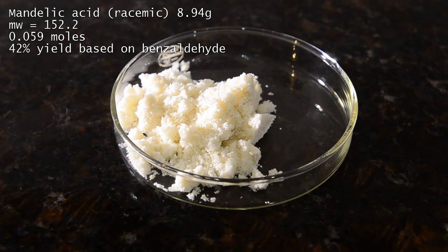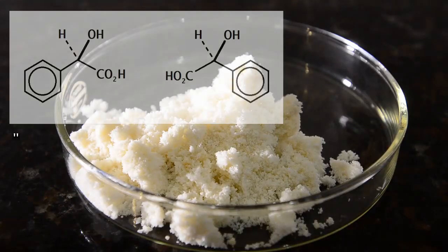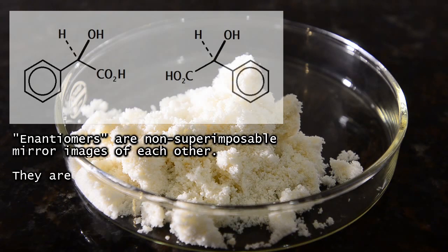We obtained 8.94 grams of product, which corresponds to a 42% yield from starting benzaldehyde. This is okay, but we're sure it can be improved. We will keep trying.